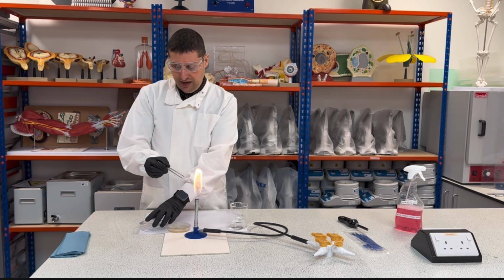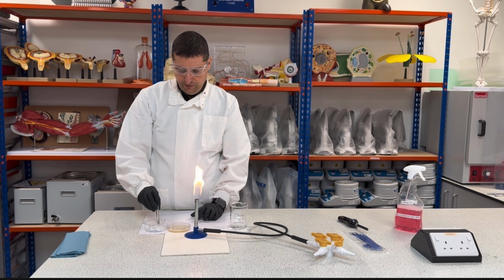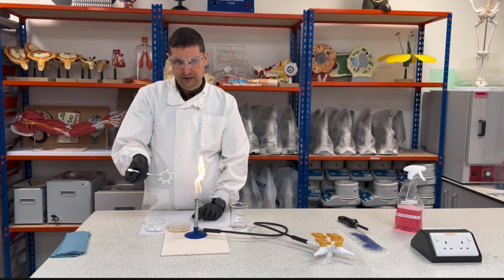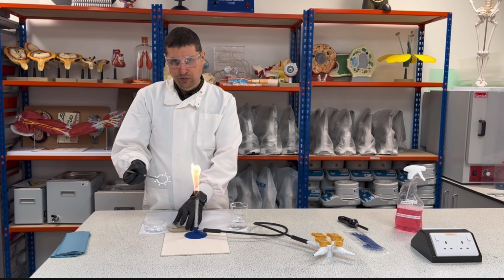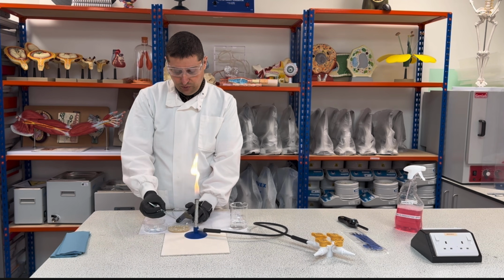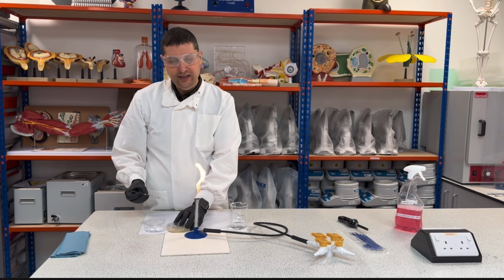Okay, so I will open this up. I will see where the name is written. So you see the name is written here, facing up. I will open this and place in the middle. And with my tweezers, I will press the antibiotic in the agar, and then I will close.